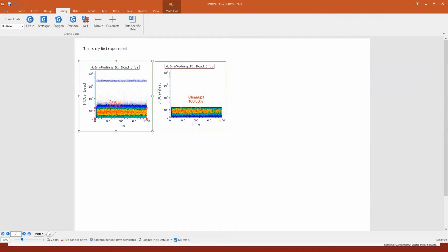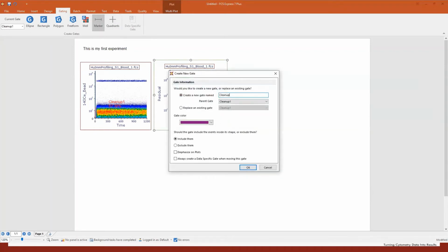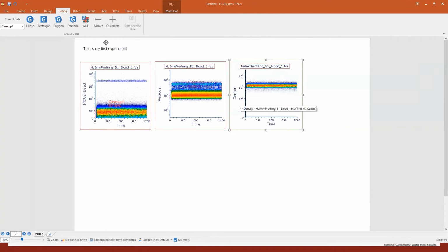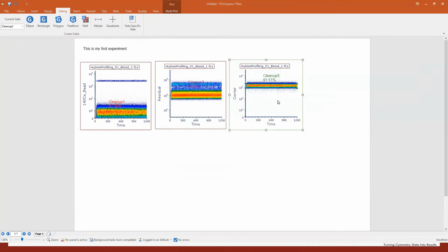So now we should go here and simply change the parameter on the y-axis to be the residual and create another gate. Here we go. Cleanup 2. Okay, and then drag and drop. And then in this case, we want the center. Okay, and again, cleanup 3 in this case. So first of all, you see that it's really easy to use.